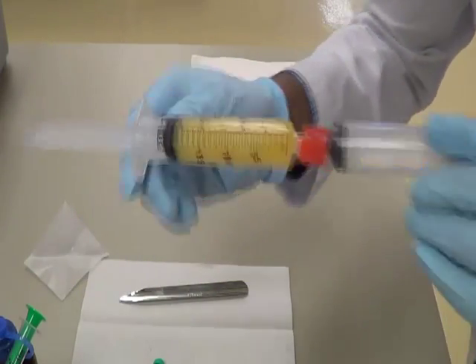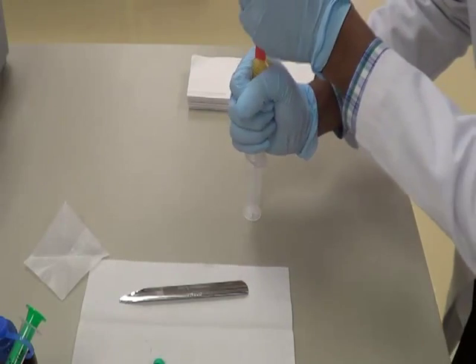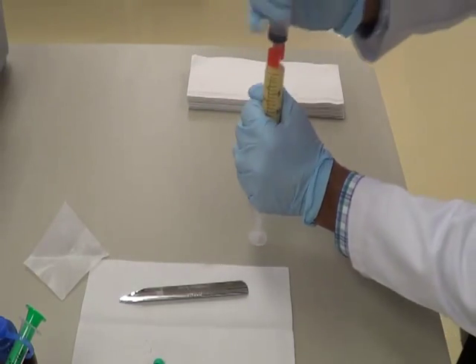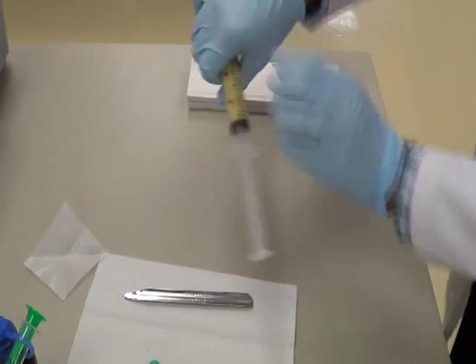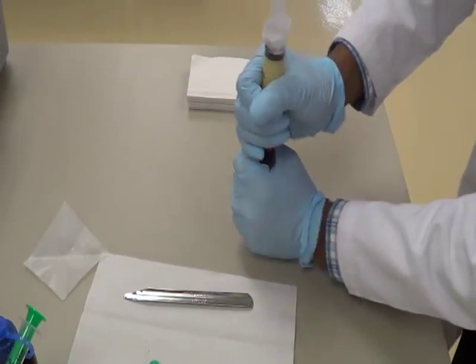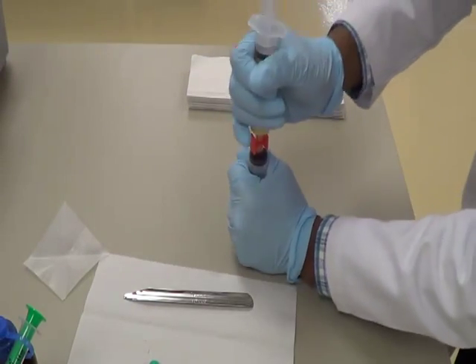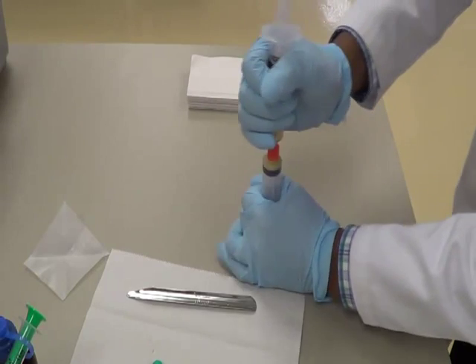Can you see this? The color is already changing. And do the same thing repeatedly for three, four times.